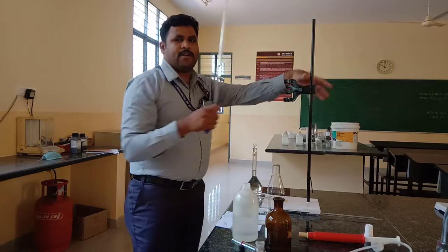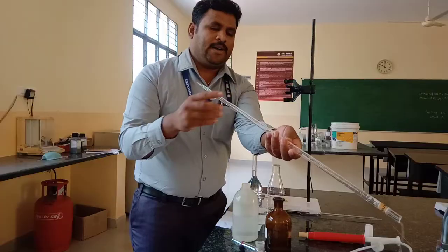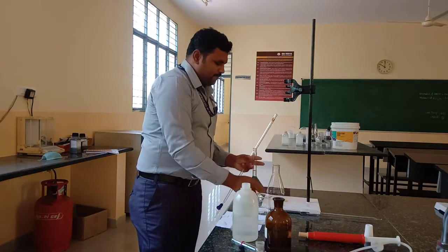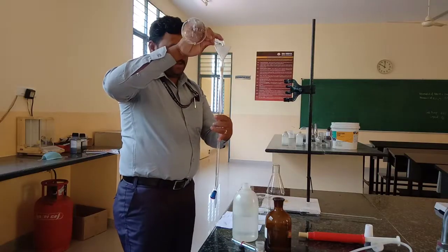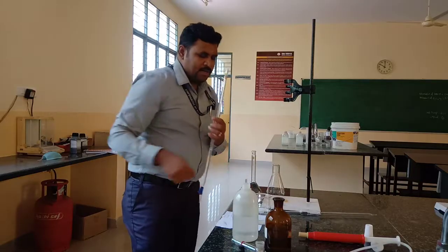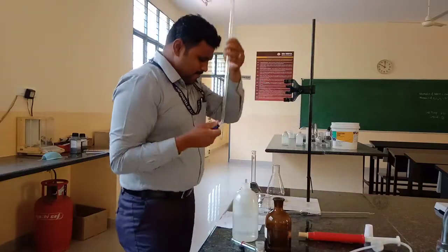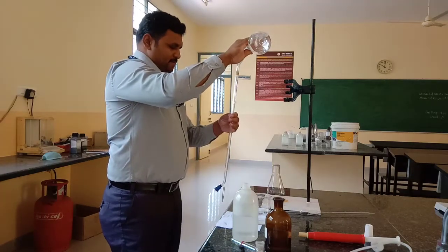Part A is over. Coming to Part B — estimation of total hardness of the water sample. The Na2EDTA solution prepared in Part A is taken in the burette. Add a small amount of Na2EDTA, then rinse with the same solution. Add the initial amount of Na2EDTA and make up to the mark.